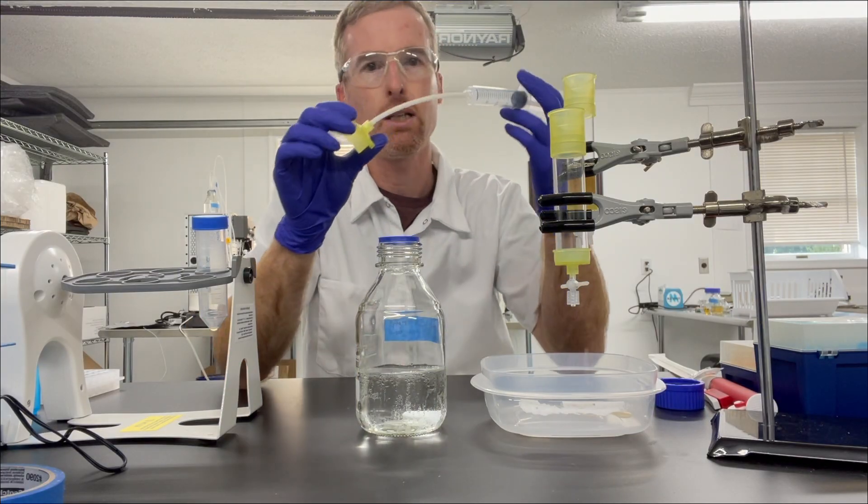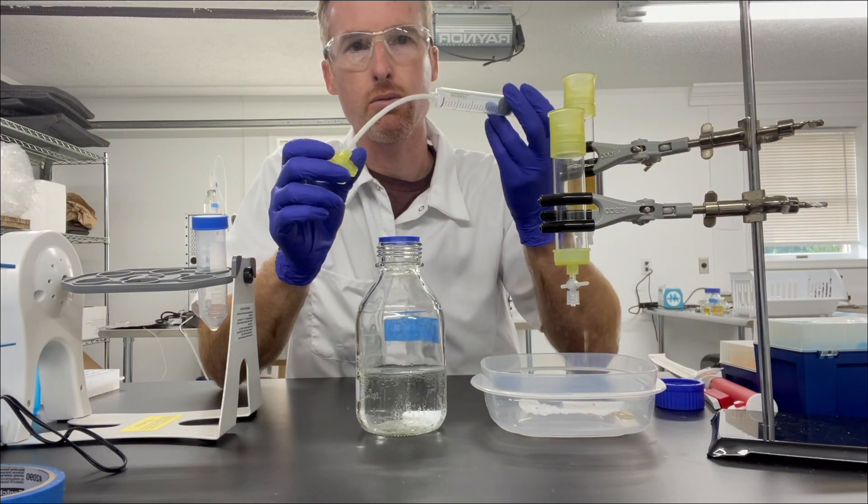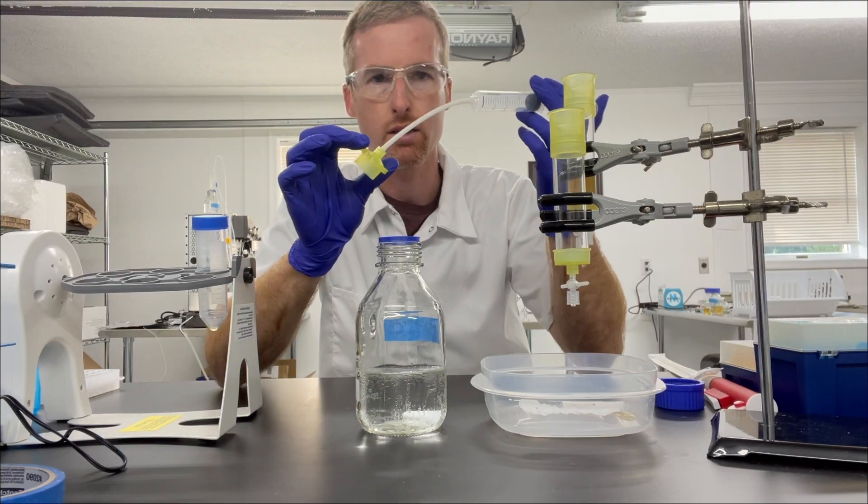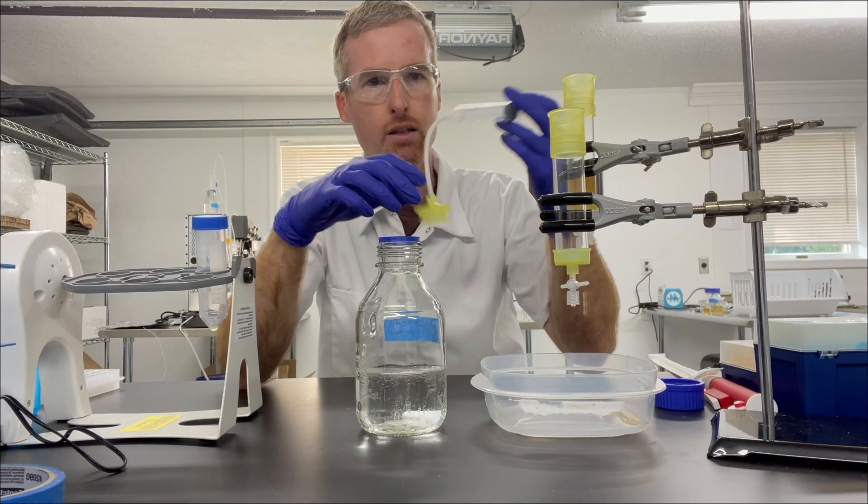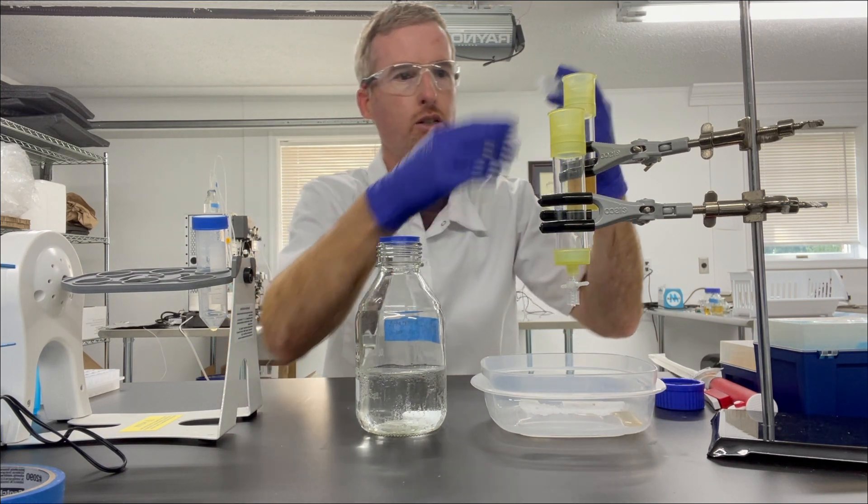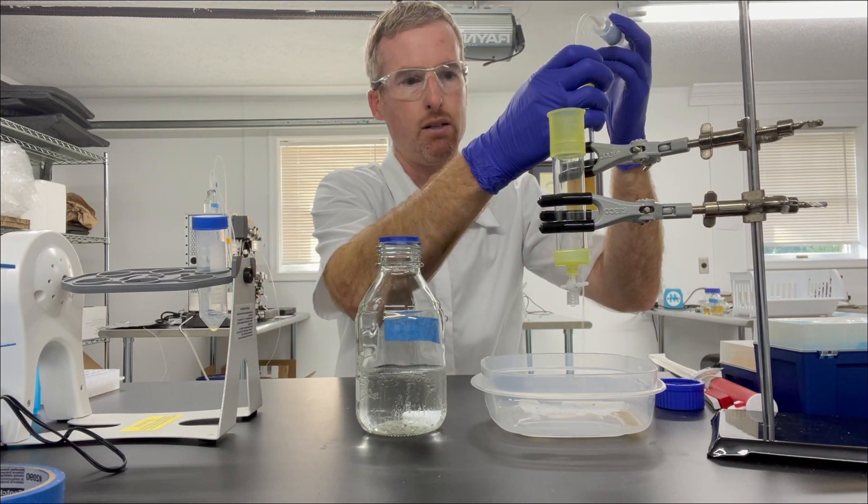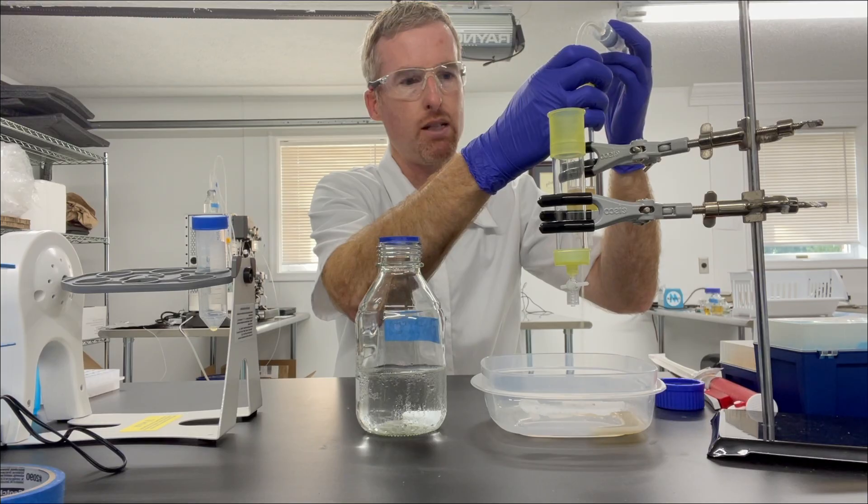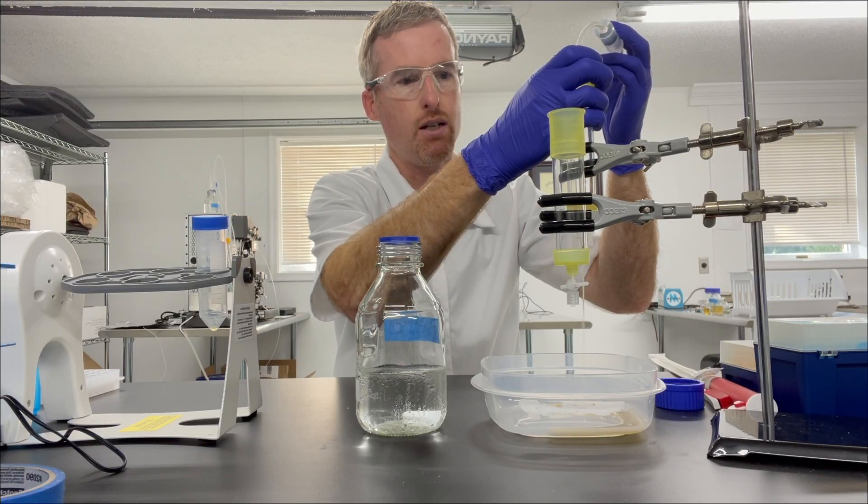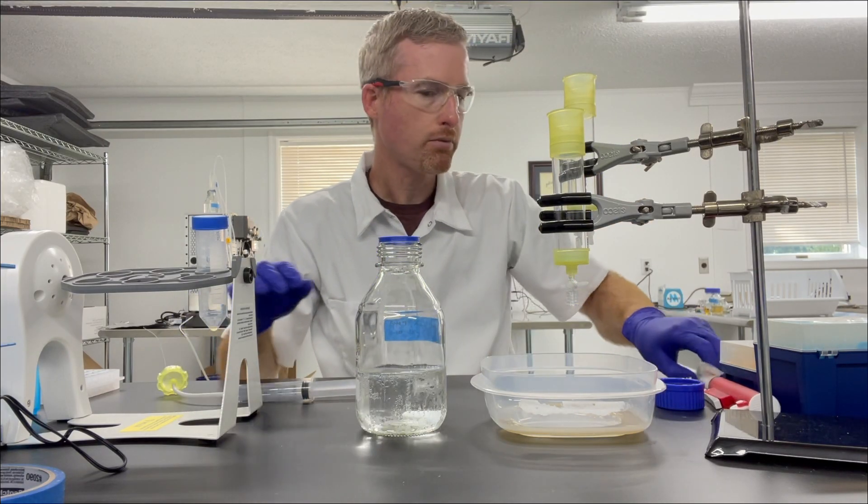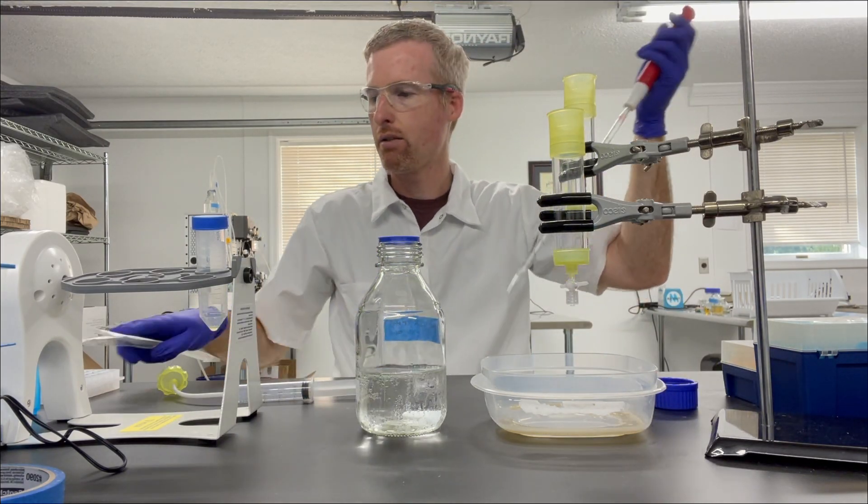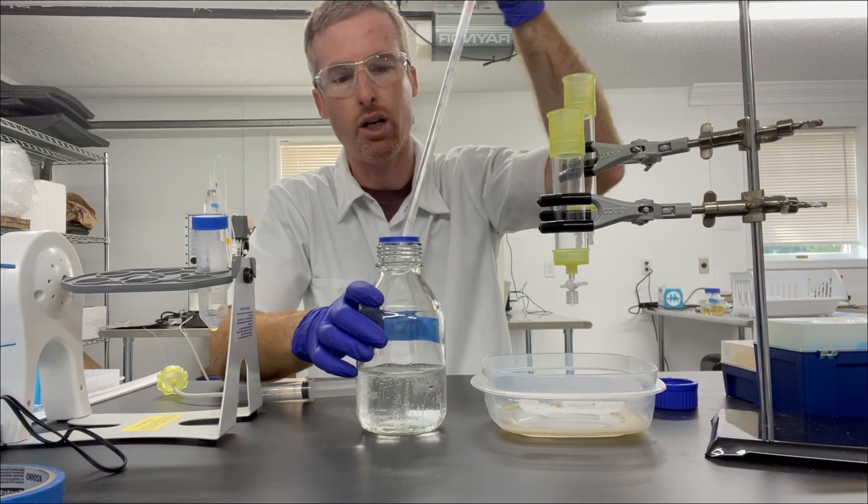So what I like to do is take a syringe and a piece of silicon tubing and a cap from the column and pull back the syringe, put the cap on, and then squeeze about 10 ml of air into the Econo column, and that immediately forces out the liquid, and I'm ready to add wash buffer.